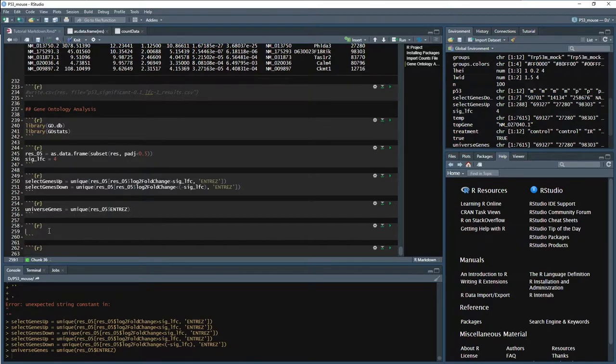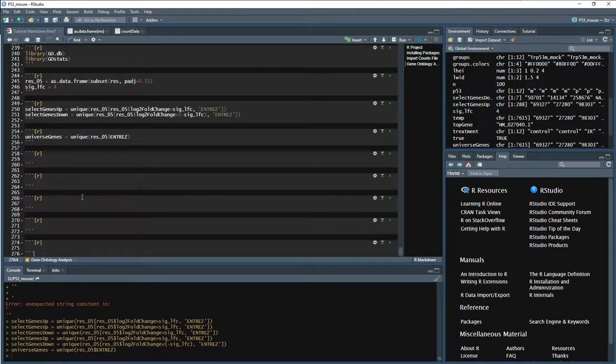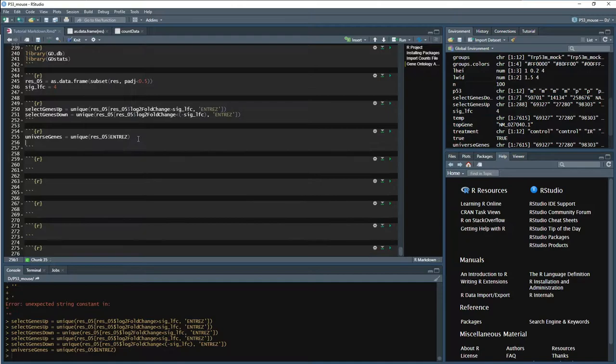Now, when we get into setting up the parameters for a Hyper-G test, we have to feed in a cutoff value. So this is going to be another thing that we can set as a variable, and then later on we can call it for our up and down. That way we don't accidentally type in one thing for one and something different for the other. We can keep it more consistent. And here we'll just do a cutoff, and we're going to set that equal to 0.01. So that'll be 1%.